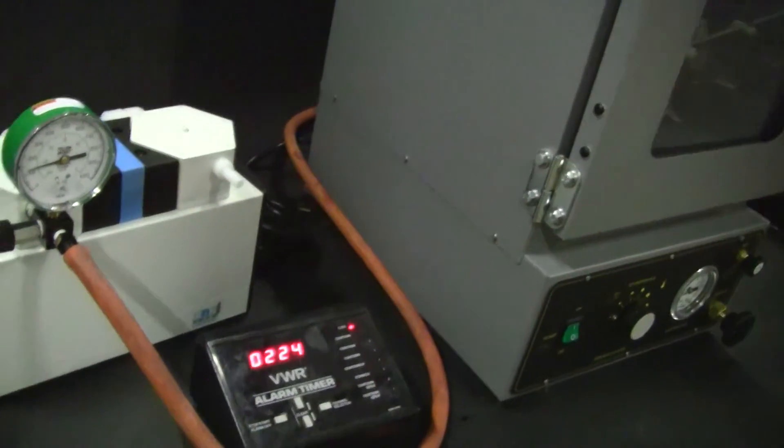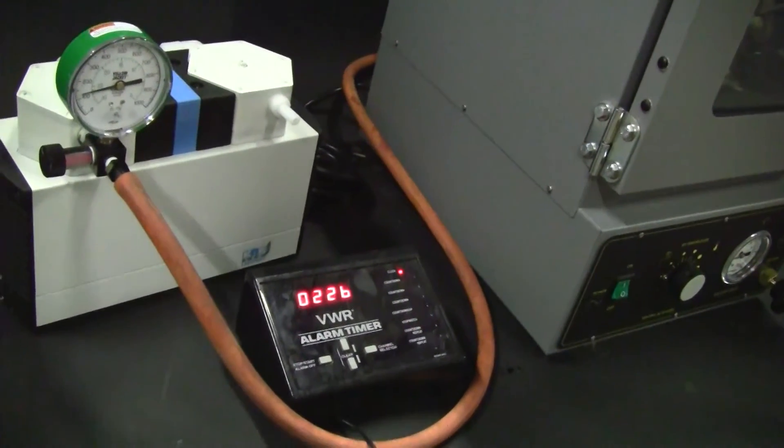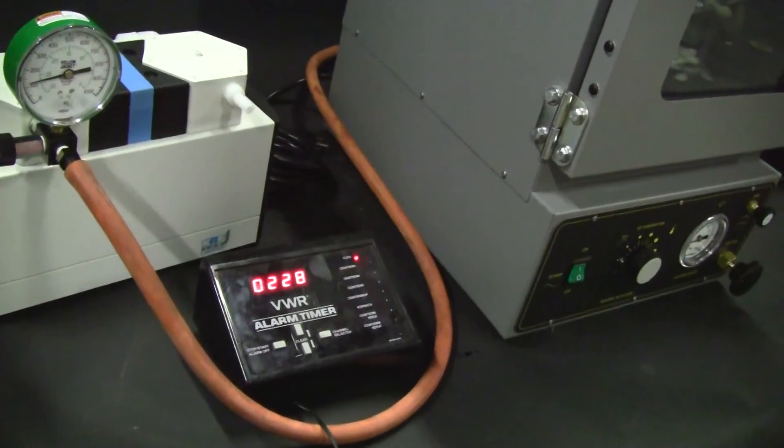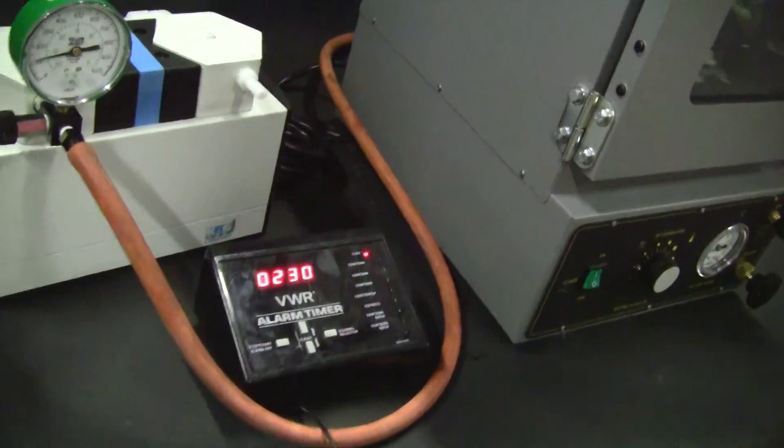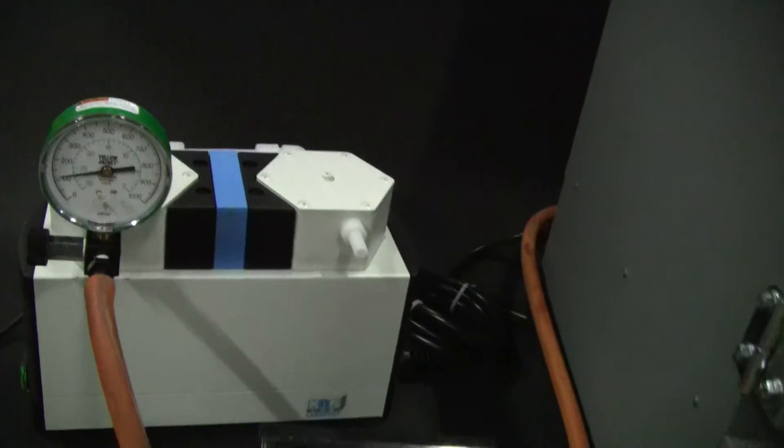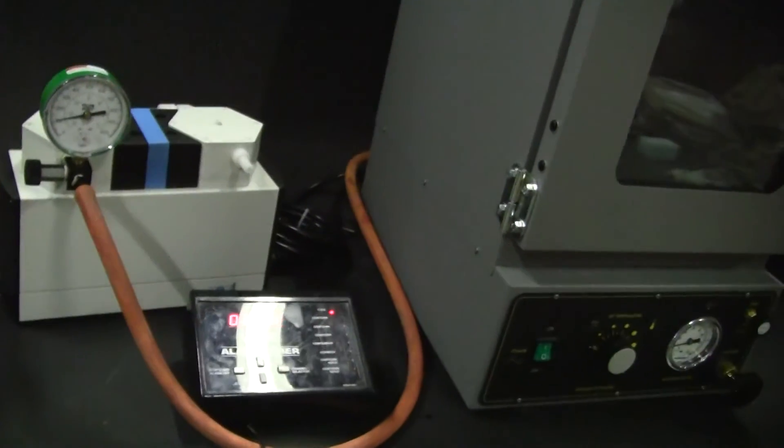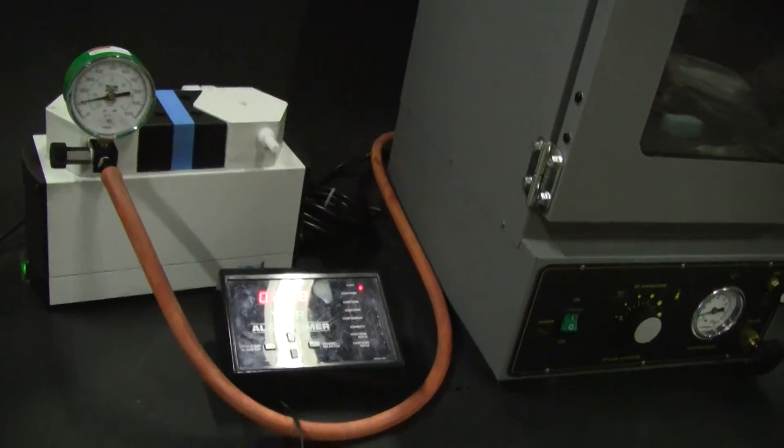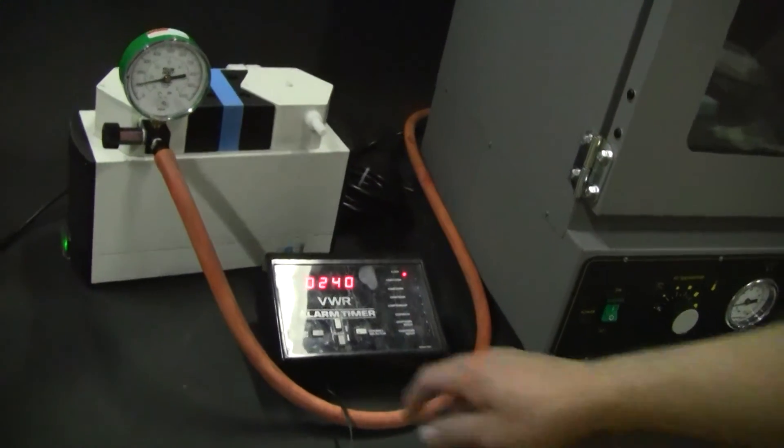It's going to be close. 5, 4, 3, 2, 1, and we're almost just about right there. And I'm going to stop that and say mark.